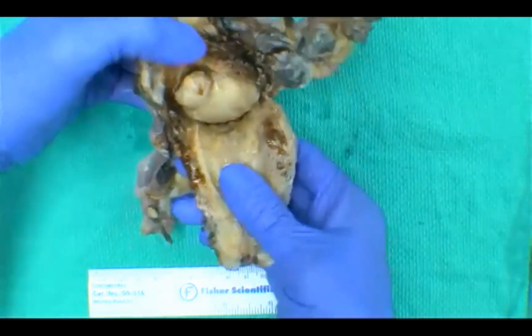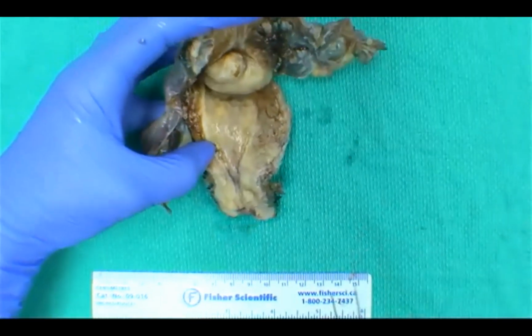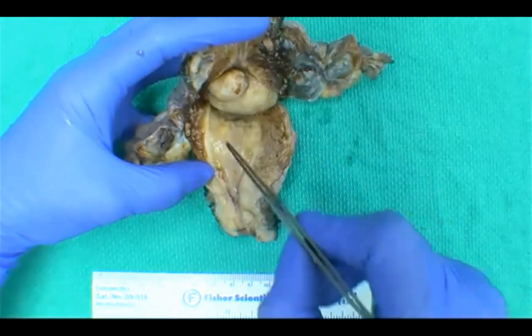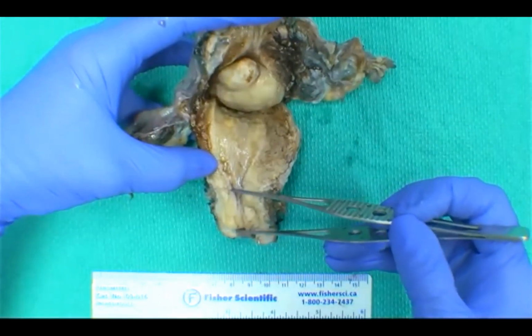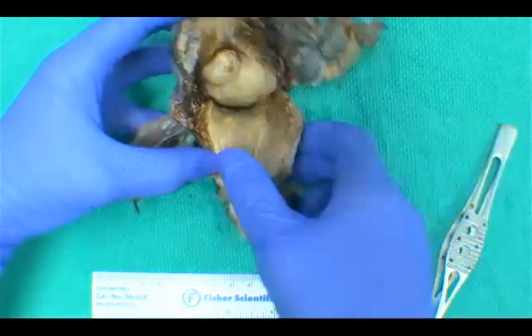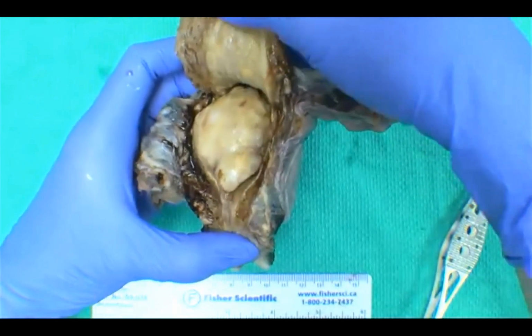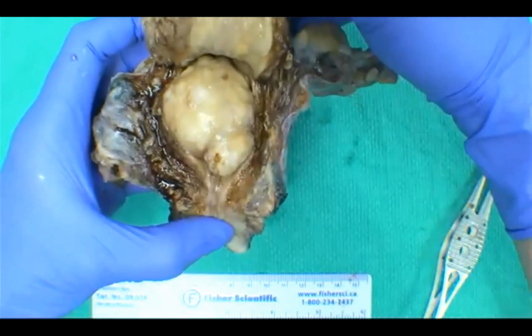So on the inner surface of the uterus, we usually prep these by sticking blunt-end scissors into the os and then cutting on the lateral aspects to expose the endometrial cavity. Our endometrial cavity is this triangularly shaped region here, which I'm outlining with my forceps. More inferior is our endocervical canal and our endocervix and lower uterine segment. Okay, and so looking within the endometrial cavity of the specimen, you can see this lobulated and protruding thing here. So what could this be?